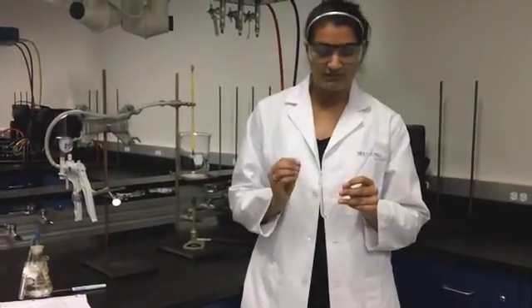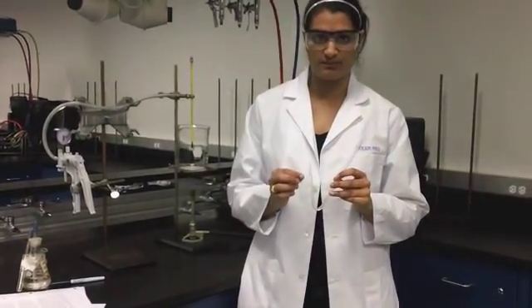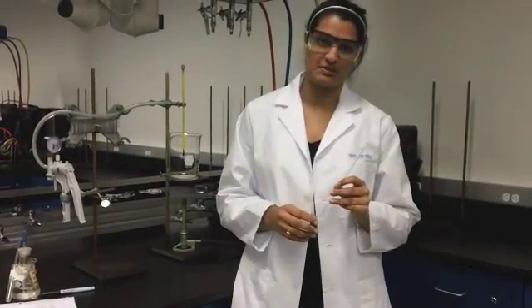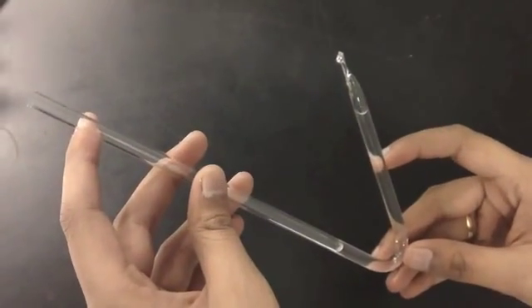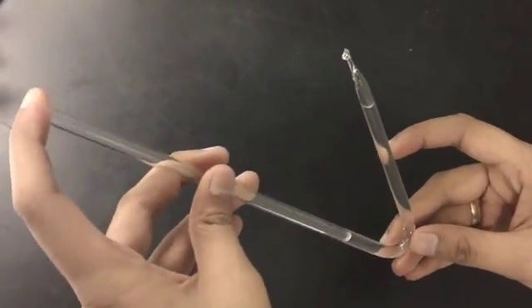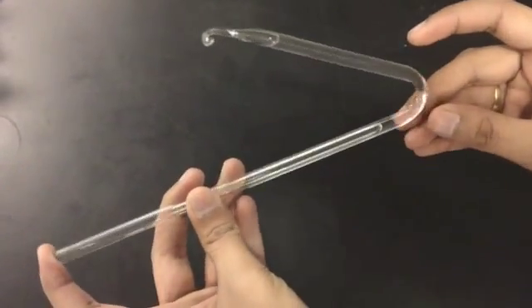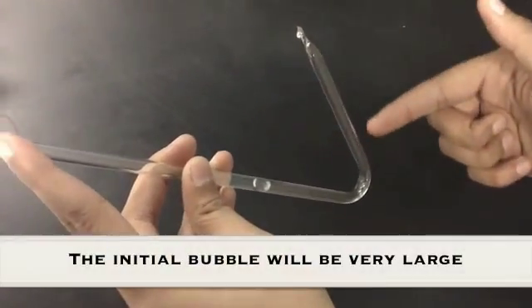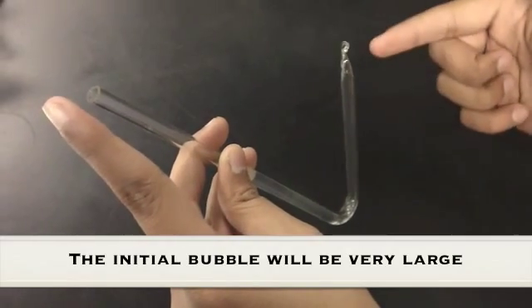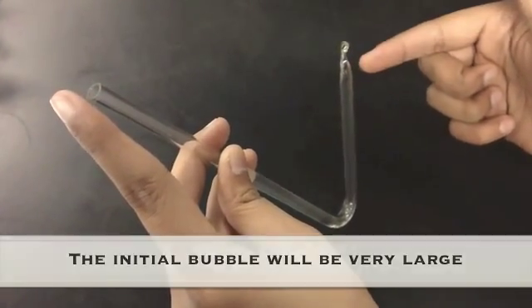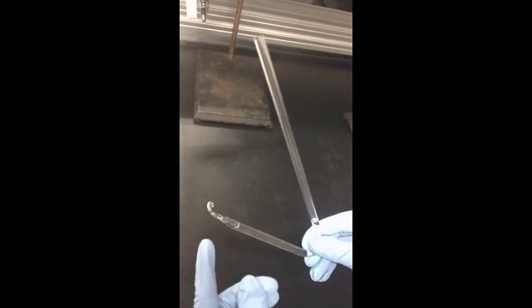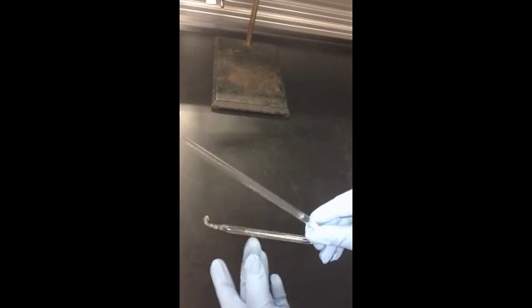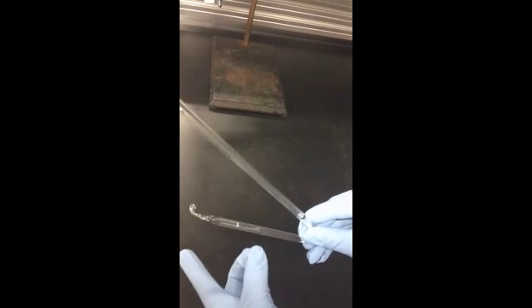The next step is to actually make a very small air bubble in the closed end of the tube. This is a very tedious step and you may have to repeat the process many times before you get that very small air bubble. In order to create an air bubble, take your isoteniscope and tilt it horizontally. You'll then see an air bubble inside the closed end of your tube. In order to decrease the size of the air bubble, tilt the isoteniscope slowly and tap the air bubble to break it into smaller parts.